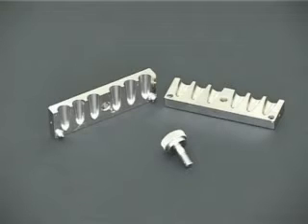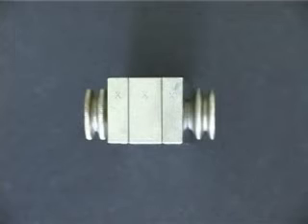This traditional suppository mould consists of three parts — two sides held together by a screw. Normally letters or numbers will be etched on each part of the mould to show that they match.